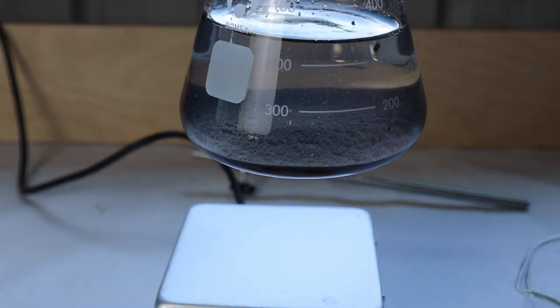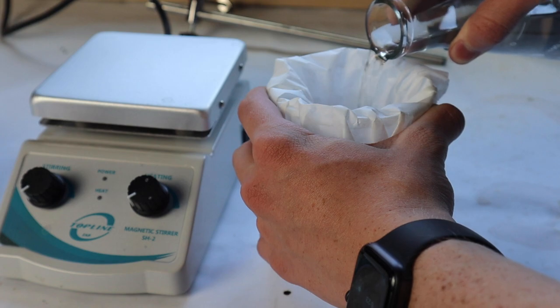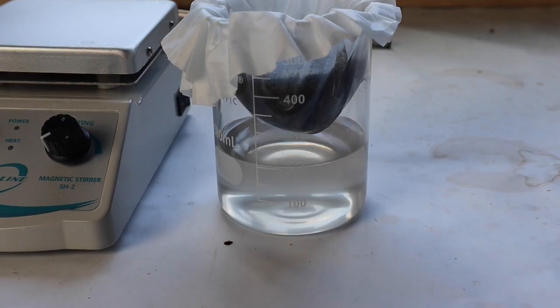I let it sit for about an hour and it looks pretty clear now. I'm going to transfer it to a beaker now, but first I'm going to filter it through some coffee filters. The liquid that came through is pretty clear. It's a little bit cloudy so I'm going to filter it a few more times.